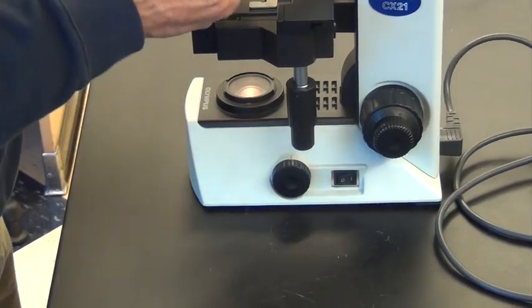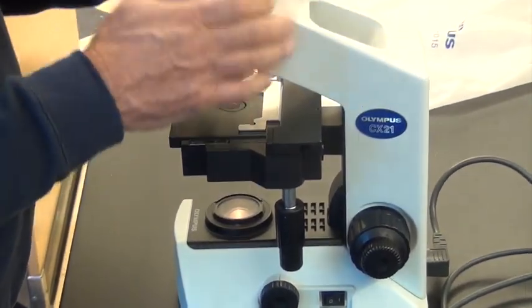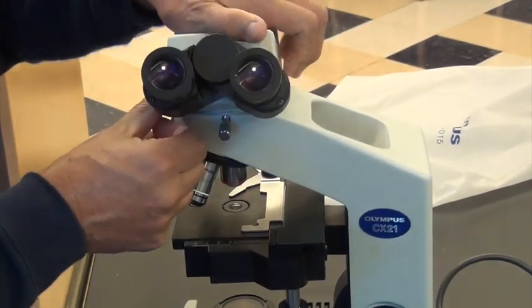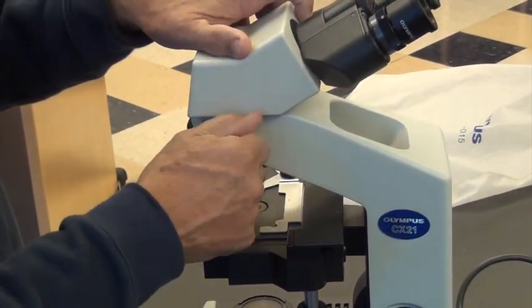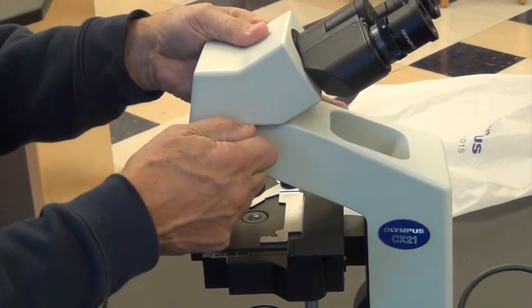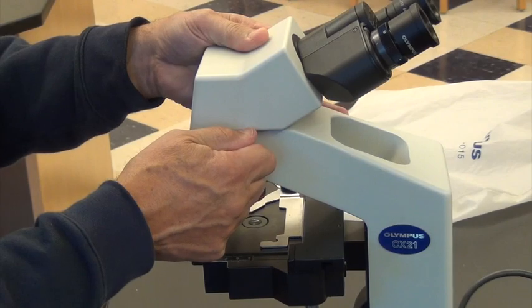You don't want to really mess with this — it is in place generally — but in some microscopes, if you would prefer, you can turn it this way. It's a little more compact. Always make sure this set screw, or thumb screw, is tight.